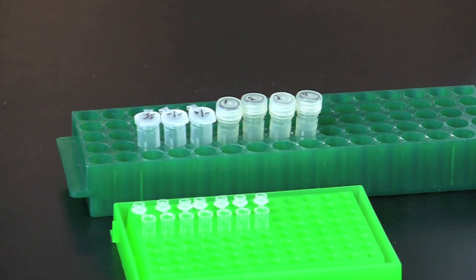This is a good stop point for this protocol depending upon your laboratory schedule. The DNA in the screw cap tubes can be stored at 4 degrees Celsius for up to a month. Do not freeze the samples.